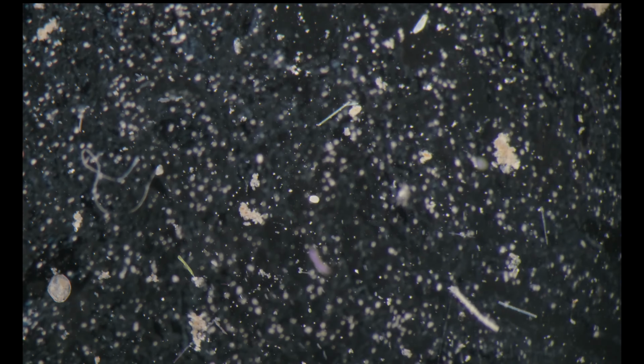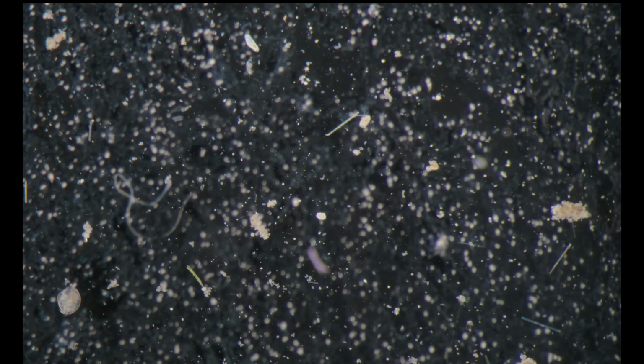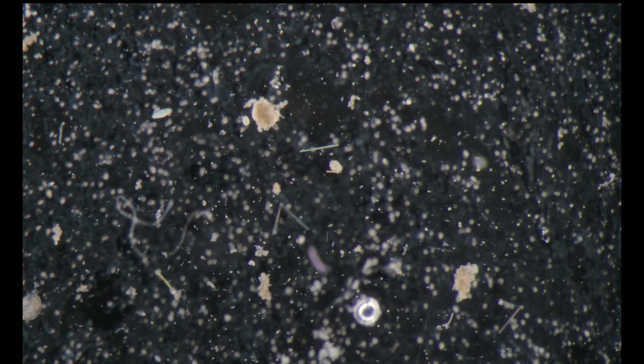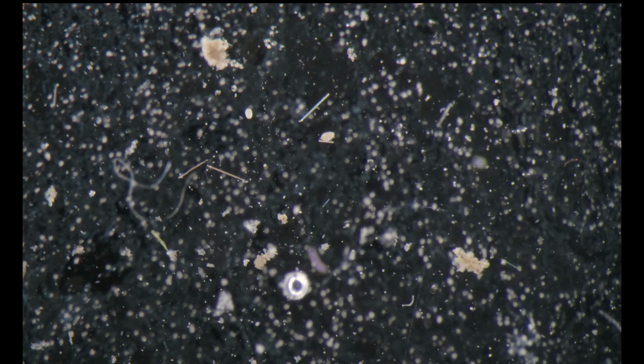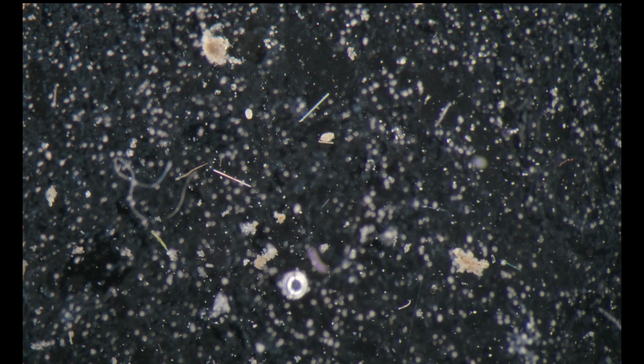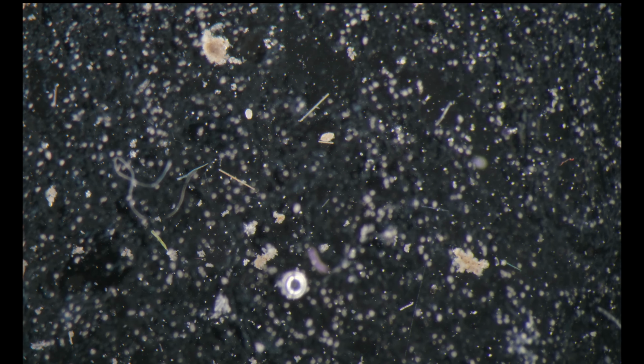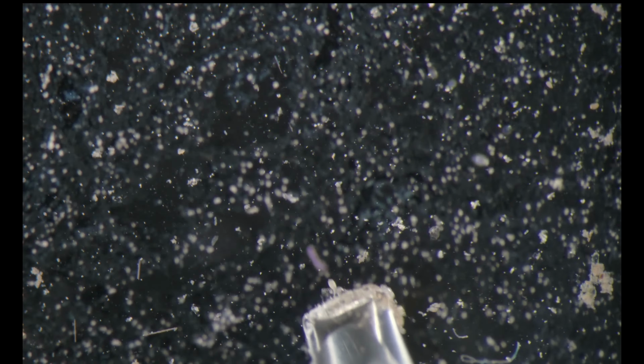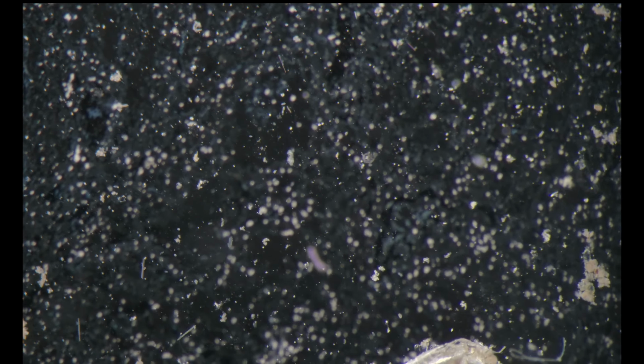Zoom out. And just a second. I want to switch, the head is dirty. So if I want, I can now easily take it in and transfer it to another place.